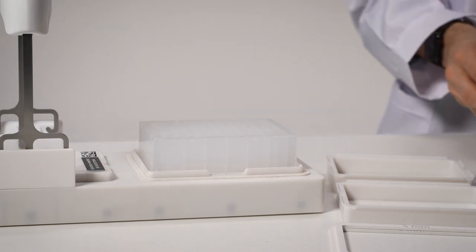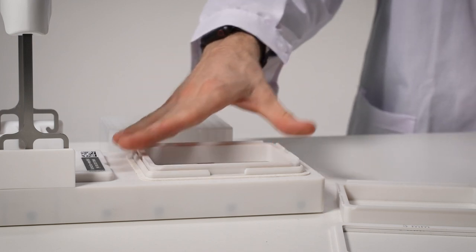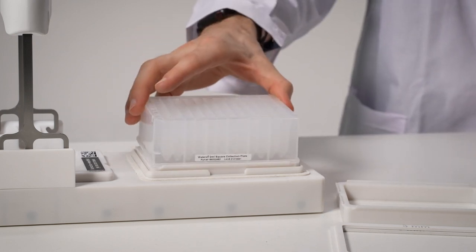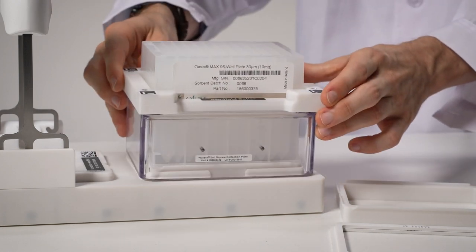Also, when working with various plate formats, adjusting the heights of the collection labware with respect to the extraction plates is important for optimal recovery and avoiding cross-contaminations. This height can be adjusted thanks to the plate spacers that are provided in the Extraction Plus kit.